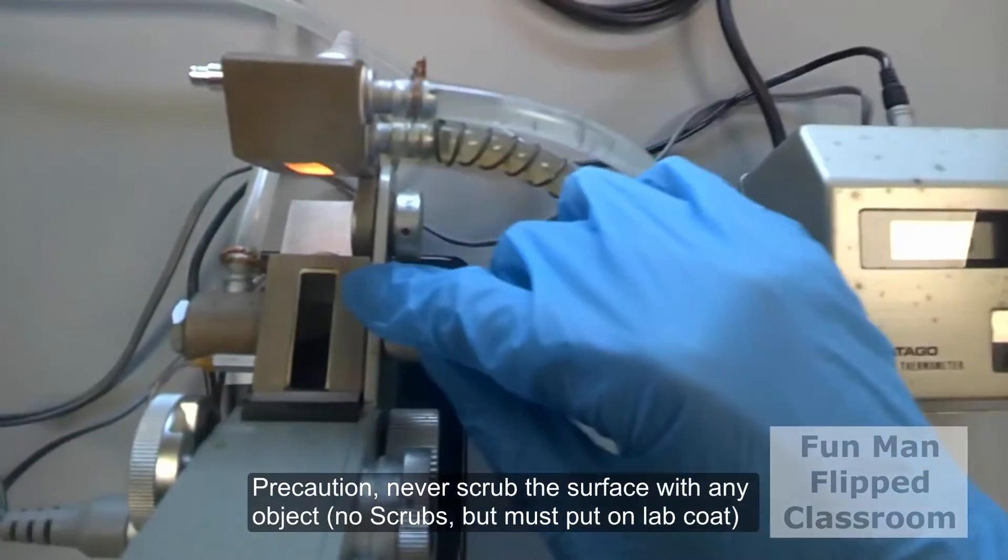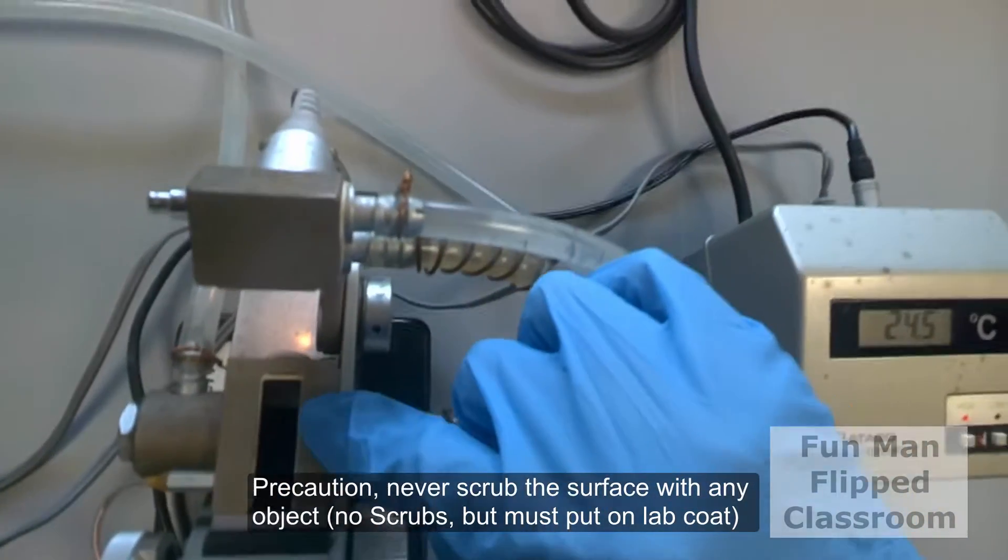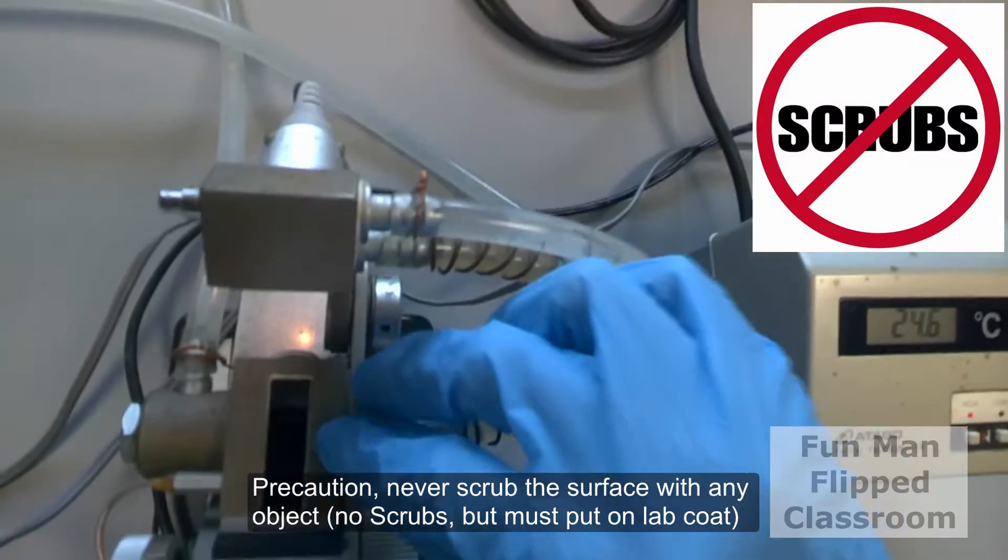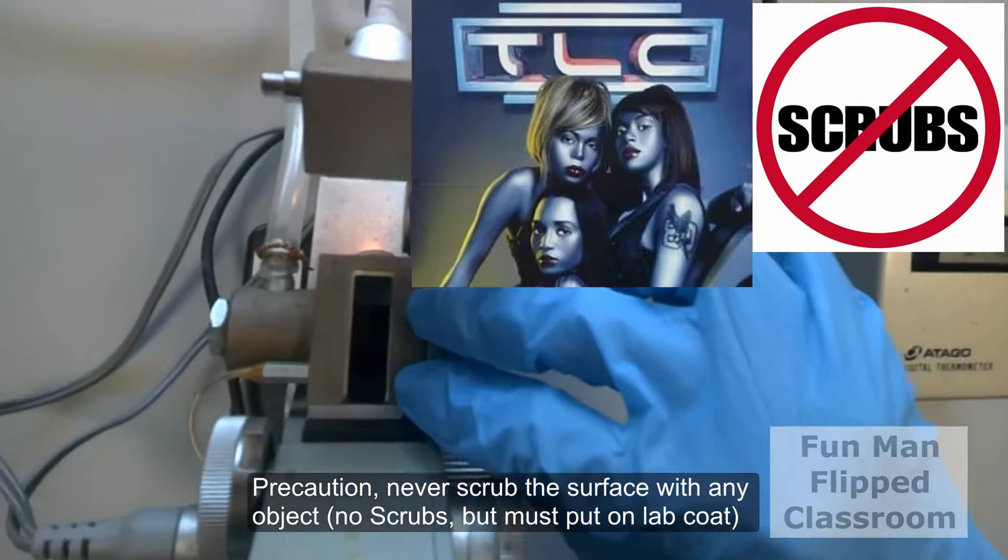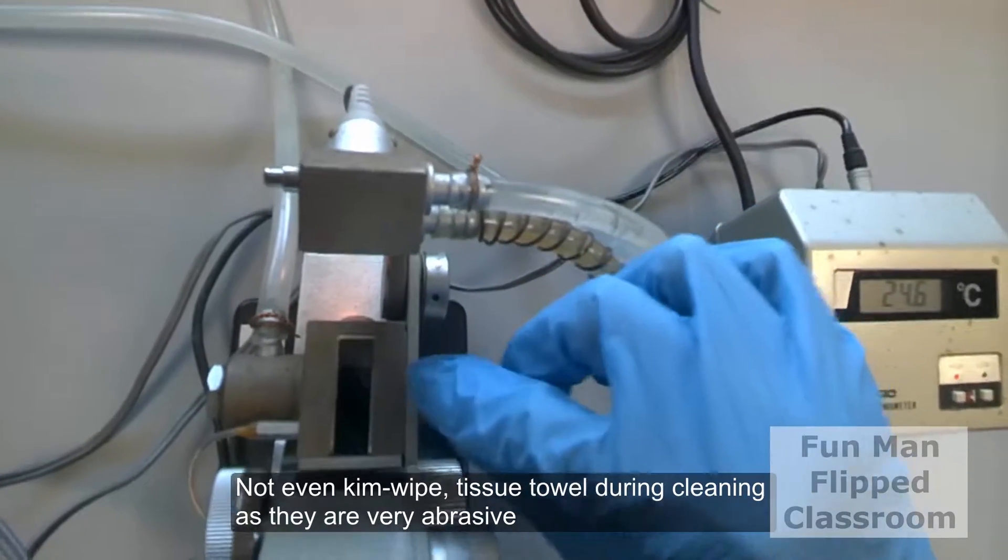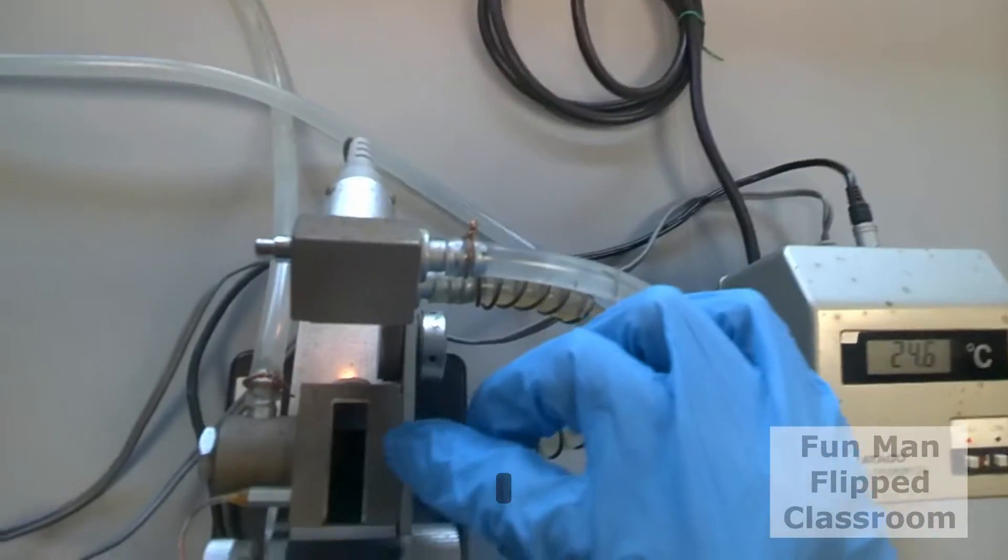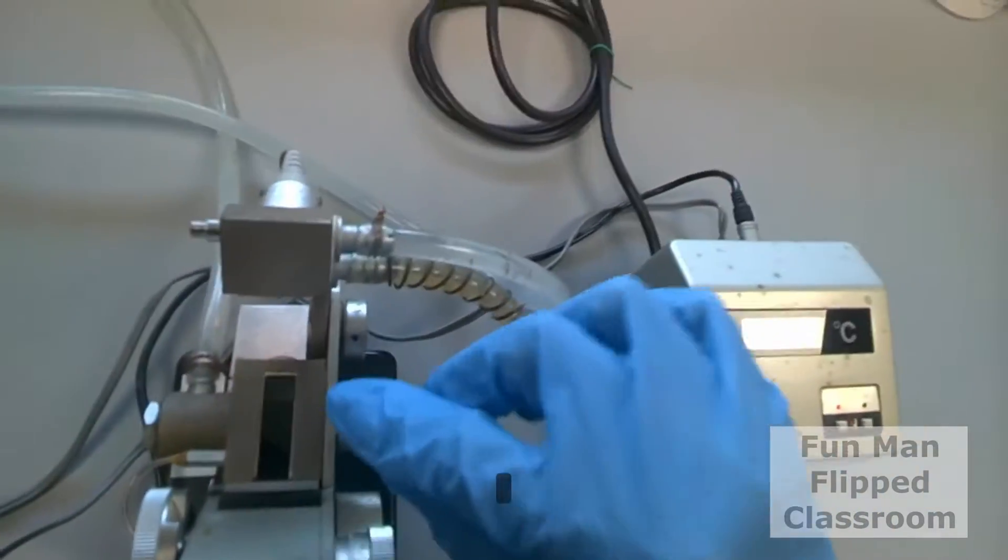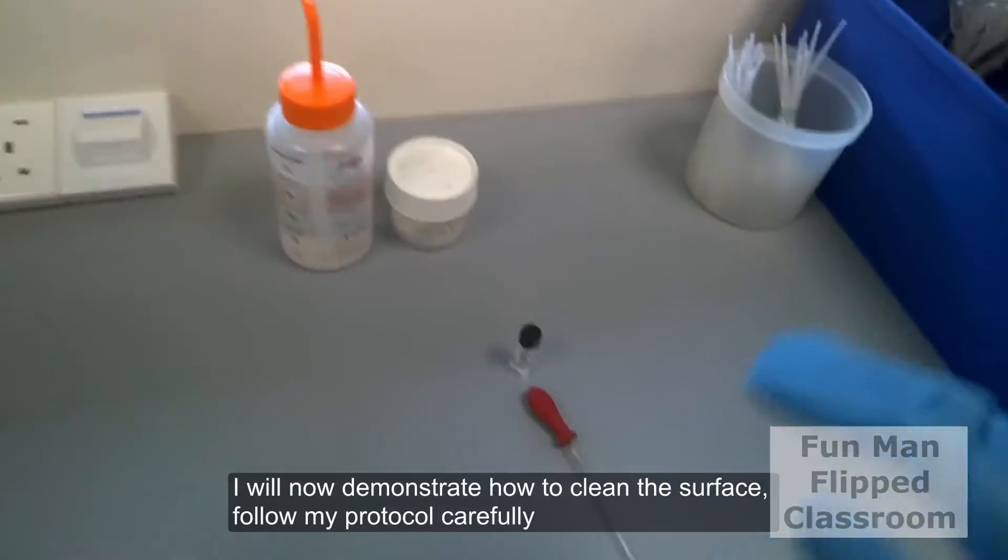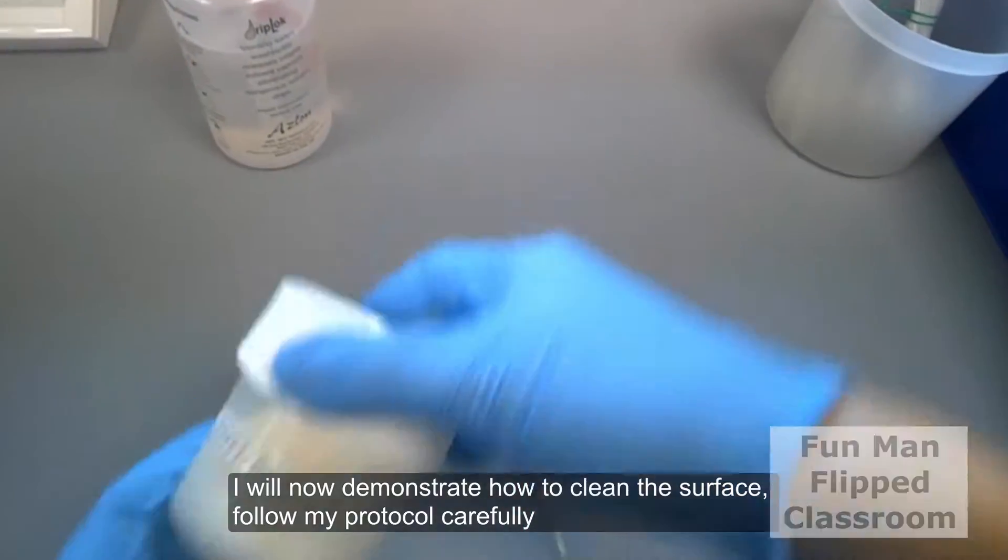Now precautions. Never scrub the surface with any objects. No scrubs. Not even Kimwipes, tissue towels, or paper towels during the cleaning as they're very abrasive. So you cannot use any of these to clean the prism. I will now demonstrate how to clean the surface. Follow my protocol carefully.